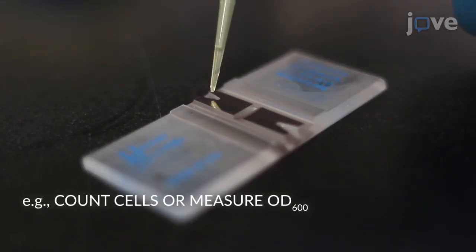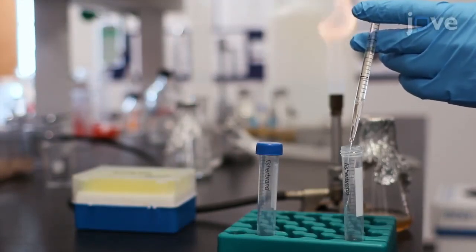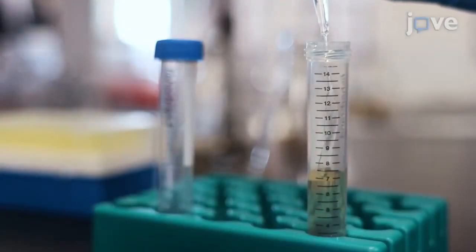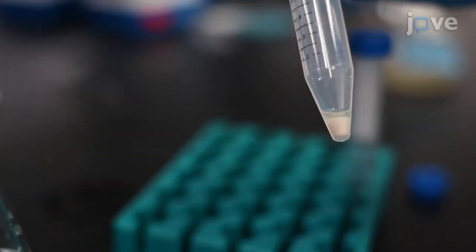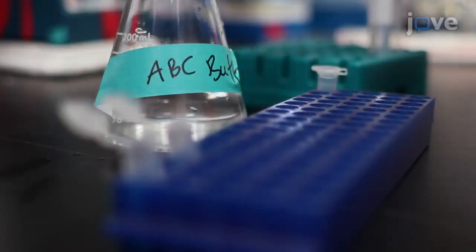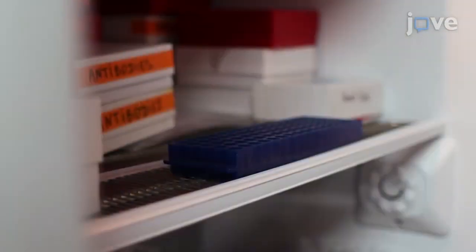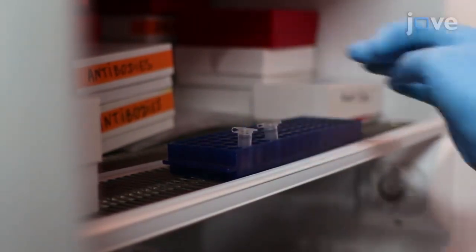For lipid extraction, determine the total number of yeast cells per milliliter of culture and transfer 5 times 10 to the 7th cells into a 15 milliliter centrifuge tube. Add ice-cold nano-pure water to bring the total volume up to 15 milliliters and collect the cells by centrifugation. Resuspend the yeast pellet in 15 milliliters of ice-cold isotonic ammonium bicarbonate buffer for a second centrifugation and resuspend the pellet in 1.5 milliliters of fresh ice-cold ammonium bicarbonate solution. At the end of the centrifugation, store the pellet at minus 80 degrees Celsius until the extraction.